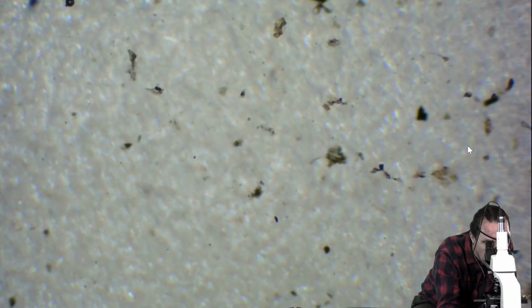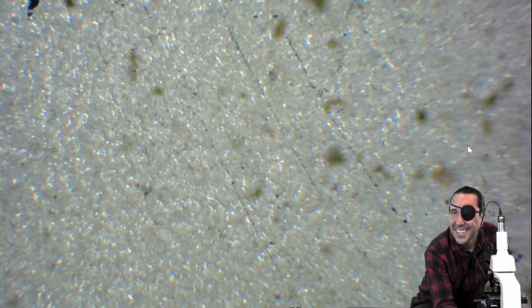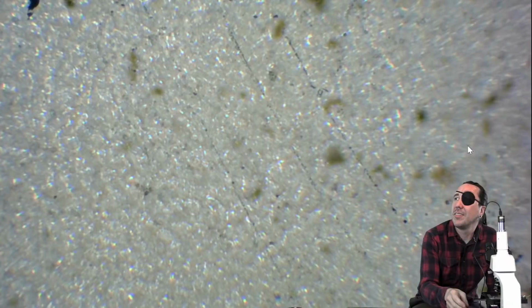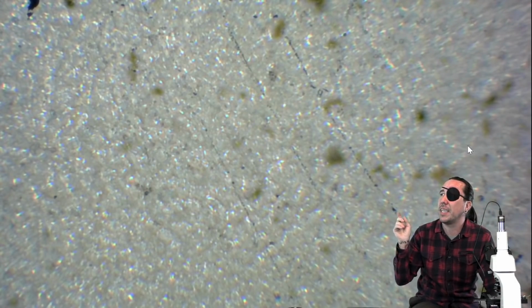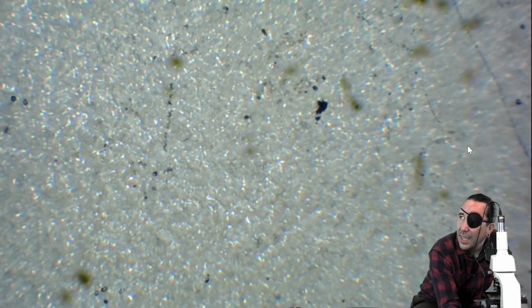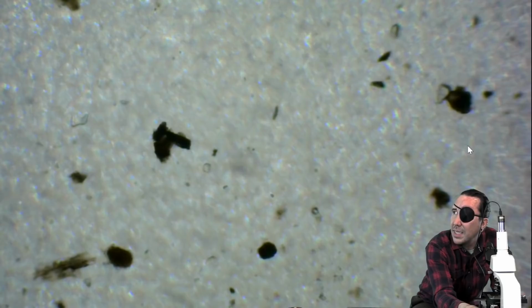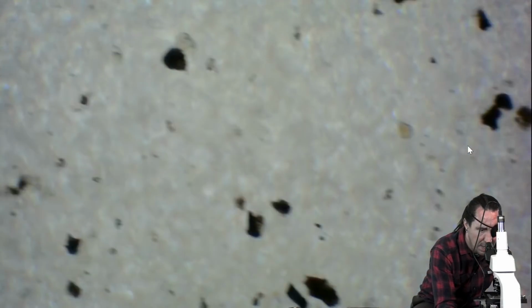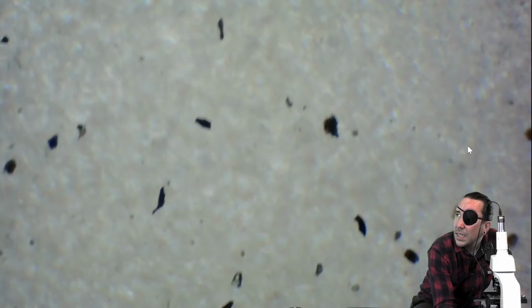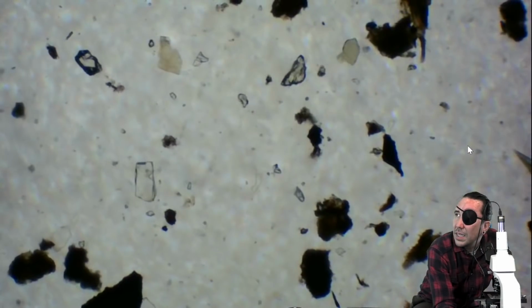Oh, I see what you're saying. I think those are from cleaning the slide. So if you look at these lines right here, I think that's maybe what he was referring to. This actually looks like maybe where somebody had wiped a slide. That's not what Dan was talking about, but you might see some things like this if you zoom in too much. If you hadn't got the slide completely clean, it looks like that's what had happened here. I'm not finding it.